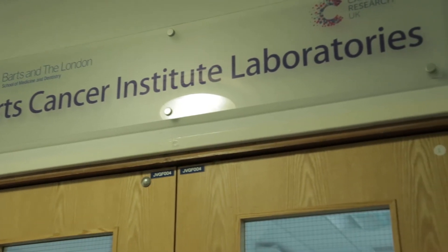Hello, my name is William Cross and I'm a PhD student at Barts Cancer Institute working under the supervision of Trevor Graham. Today we're going to talk about DNA sequencing. The purpose of DNA sequencing is to reveal the nucleotide order within a DNA segment. We're going to be sequencing the APC gene, which is associated with colorectal cancer. We've got a piece of colorectal tissue and we can sequence this to discover if there are any somatic mutations that may have caused this patient's disease.